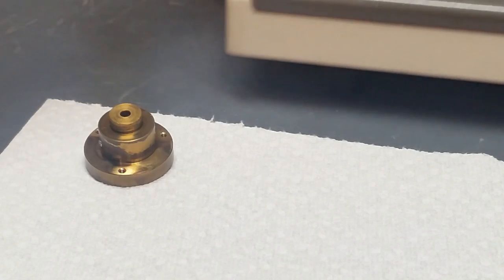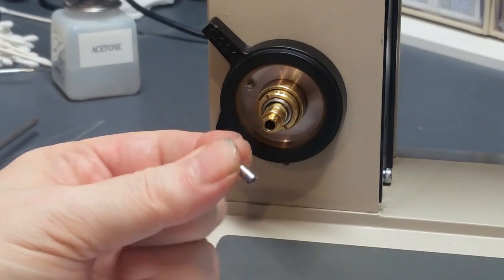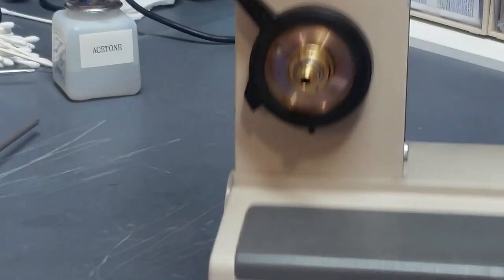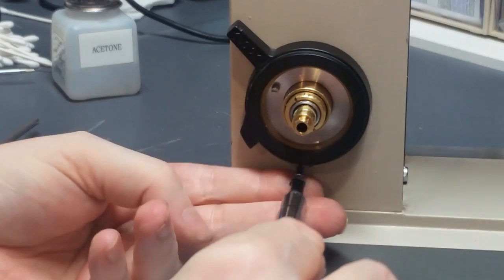Let's bring the scope back. Okay. What we do now is two things. Number one, I'm going to put this little pin stop. I'm going to screw that back into this hole here because it's a lot easier to put it on now than after I get the coarse knob put on there and focus knobs are back in place. This is a lot harder to install, so I'm going to do this now before I forget it.